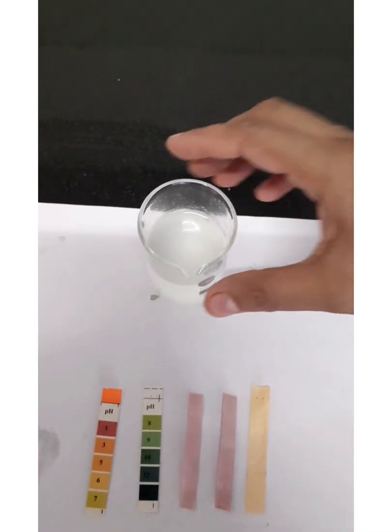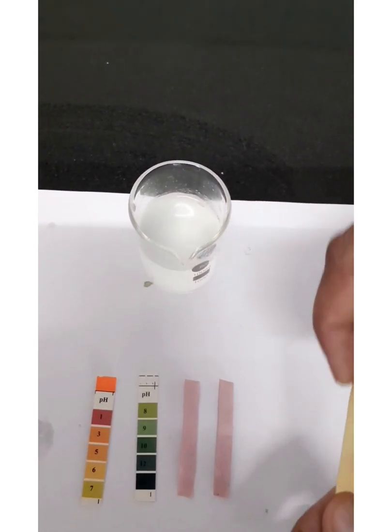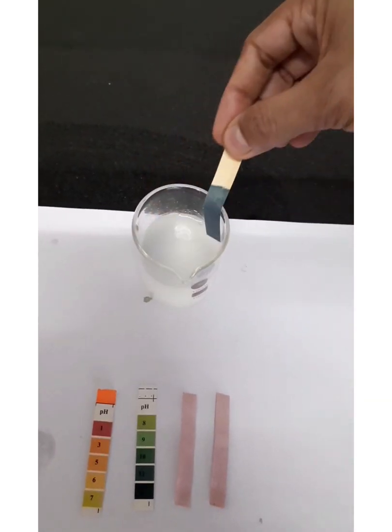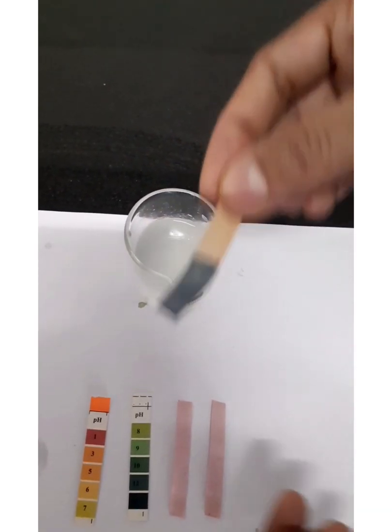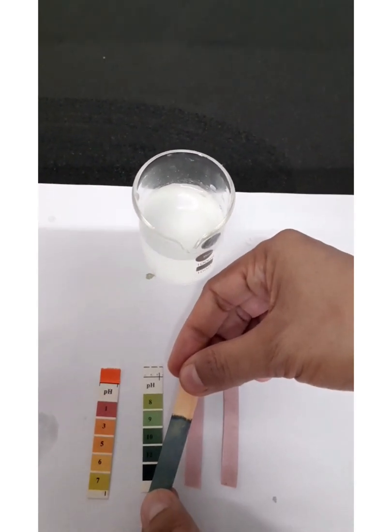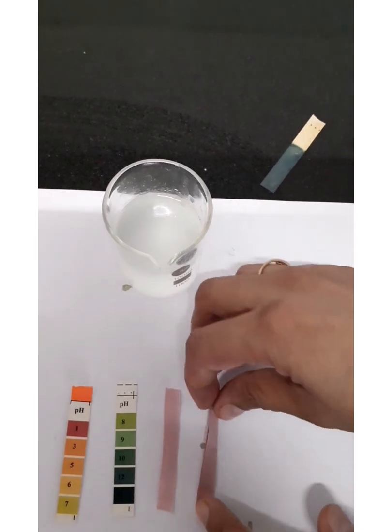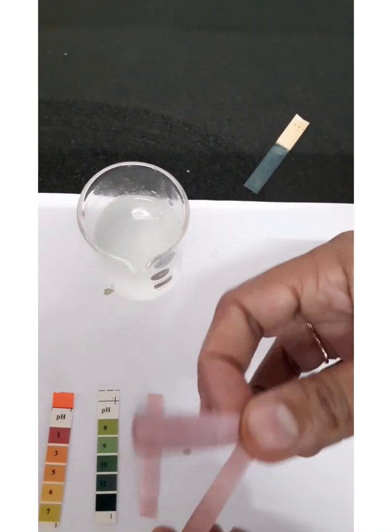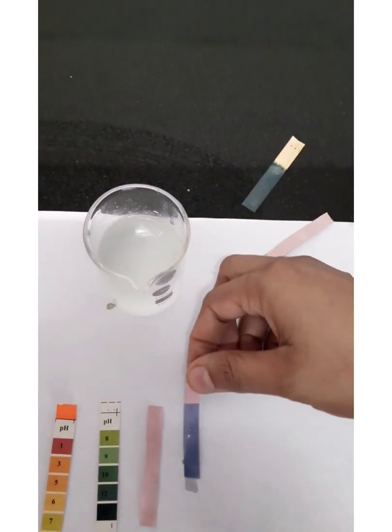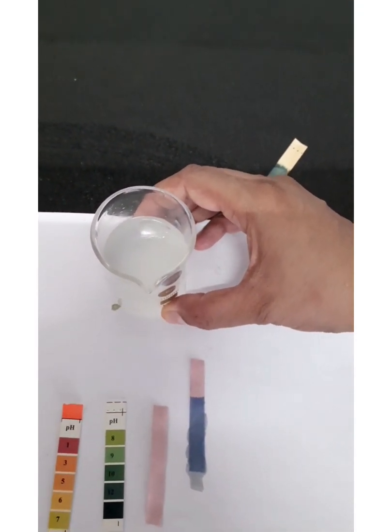Let's check the acidic or basic nature of the solution obtained as a result of burning sodium. I have this pH paper and when I put it into the solution you can see it has turned blue. Comparing with the pH chart, its pH is around 12, so it is basic in nature. The red litmus paper strip also turned blue, confirming it is basic in nature.